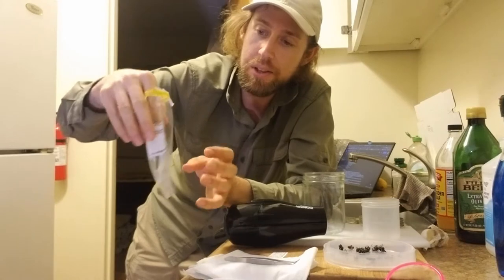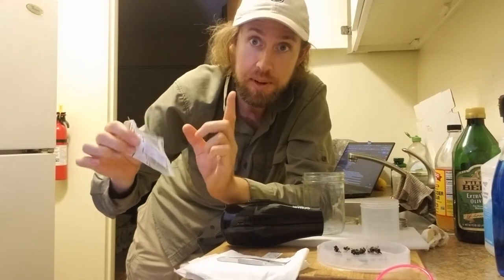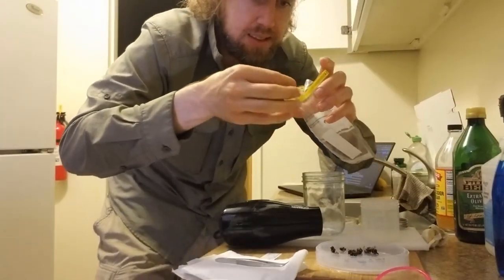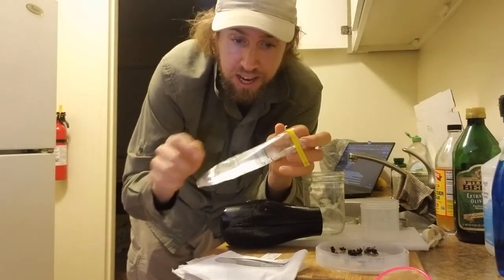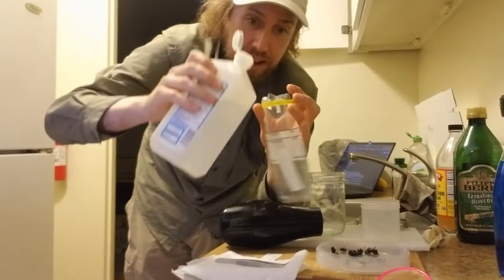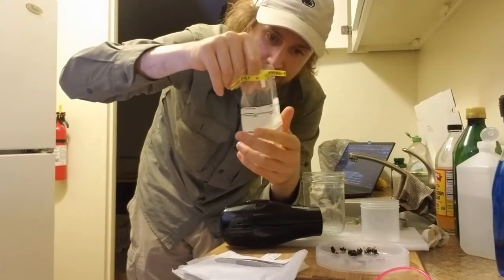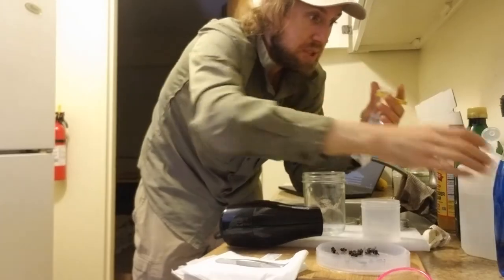So that label will go in there. One other little note for netting: I wrote down the time that I started and that I stopped, using 24-hour time, which makes things unambiguous in the future. I'm going to put my non-bee or wasp bugs in the whorl pack. Bugs tend to like to stick to the sides of these things and end up at the top instead of down at the bottom. We want to make sure any bug that's in there has fallen down to the bottom — sometimes you can coax them by swirling around and just poking to get them down into the alcohol at the bottom. So we want our label and all the specimens down in the alcohol at the bottom. We have a little bit of 70% alcohol in there — that should be good.